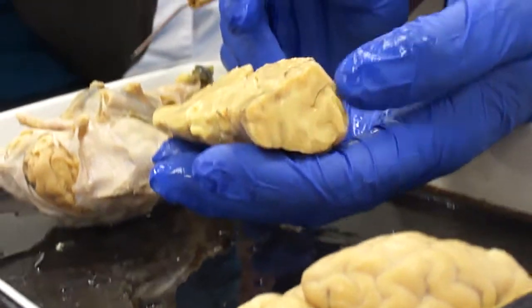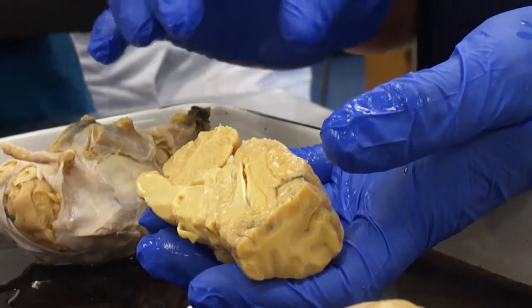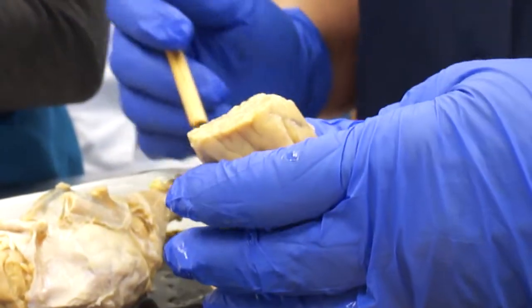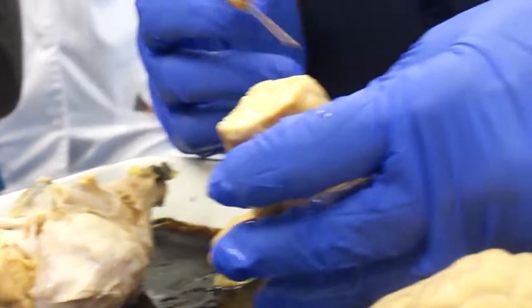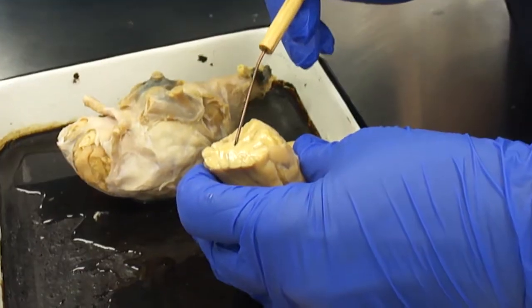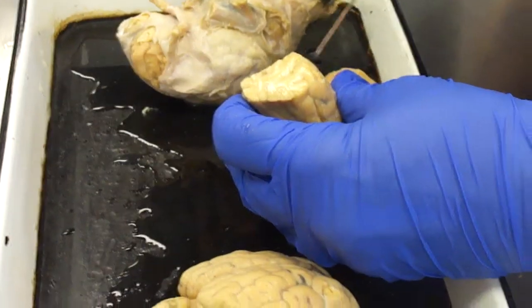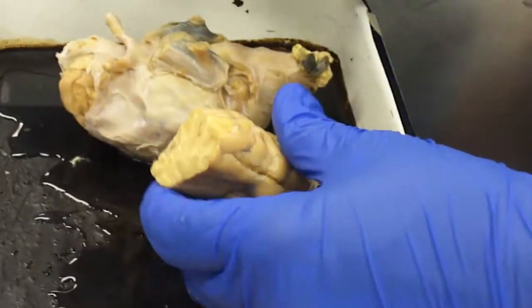Okay, so the cortex and medulla. Remember I said there's cortex and medulla now too in the brain. The cortex would be the outer tissue, and the medulla would be the inner tissue. All we can see here is cortex. In order to see medulla, we have to cut it open, and that's why I did a frontal lobotomy on this brain here. Okay, and you can see the different color. Here's your white matter, central or more internal. The white matter would be the medulla, and the gray matter, which on this brain is kind of brown, is the outer cortex. The cortex is where the cell bodies are, so that's your thinking part. That's where the decisions are made.